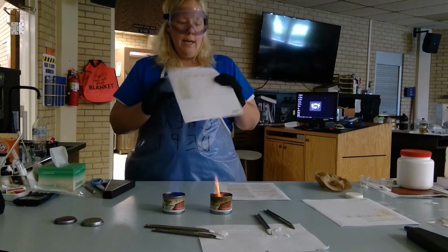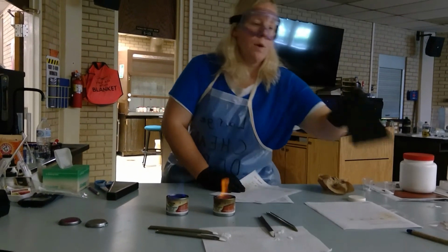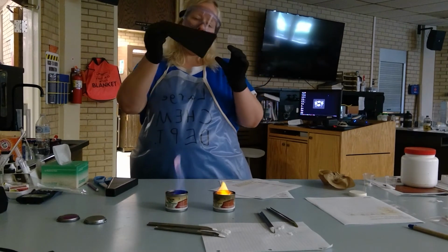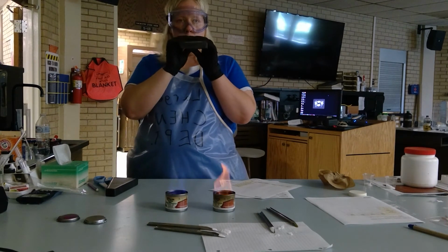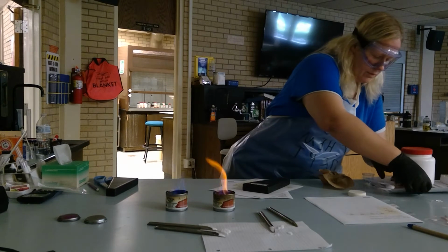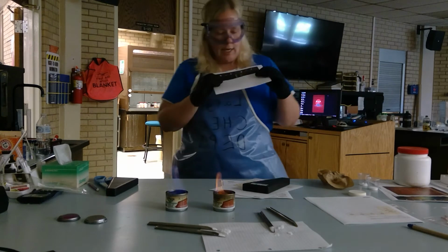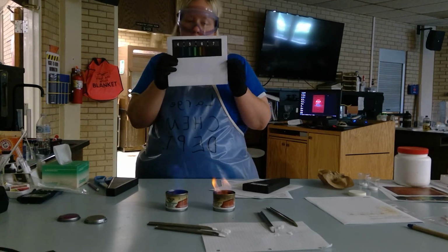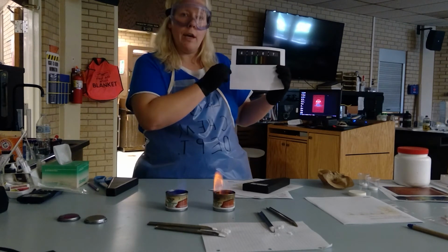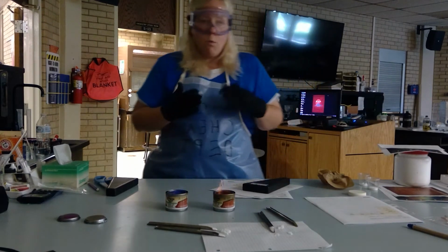Now, the idea for the rest of this table was that we would take your sticks and burn them. While your stick was burning, you would look through your spectroscope and see if you could see a line. I can do this without making a mess. You would see something that looks like this. Now, this is not what you would see, but you would see these lines. Each sample is different, so you may see 1 line, you may see 2 lines, but you should see at least one line.